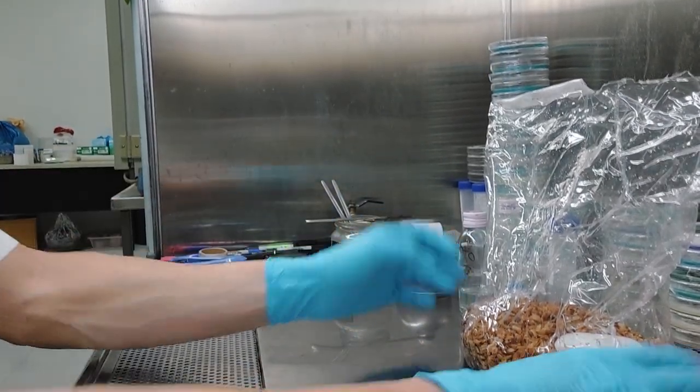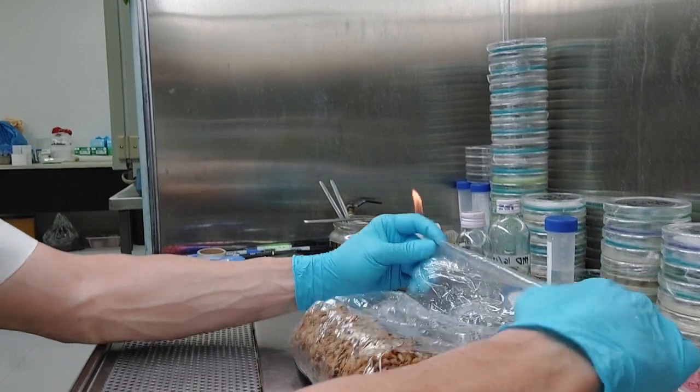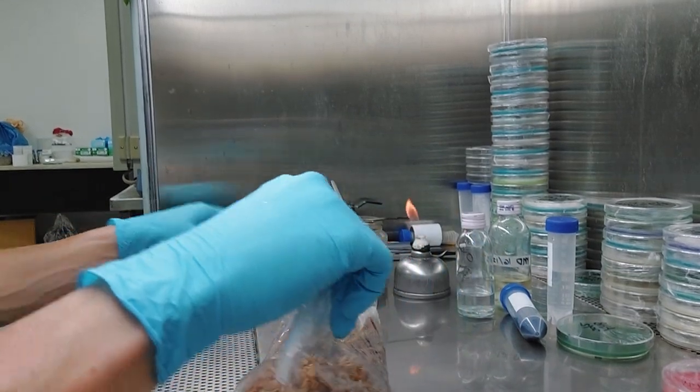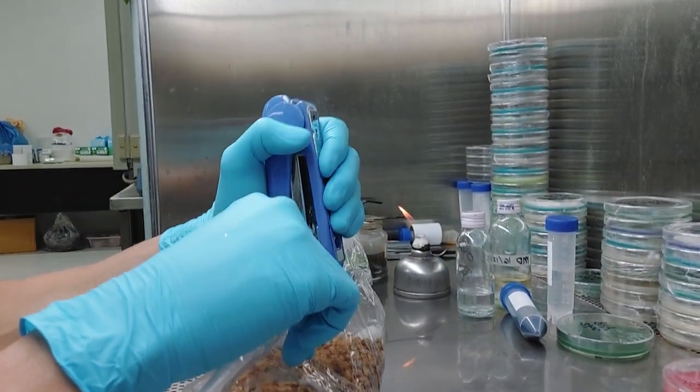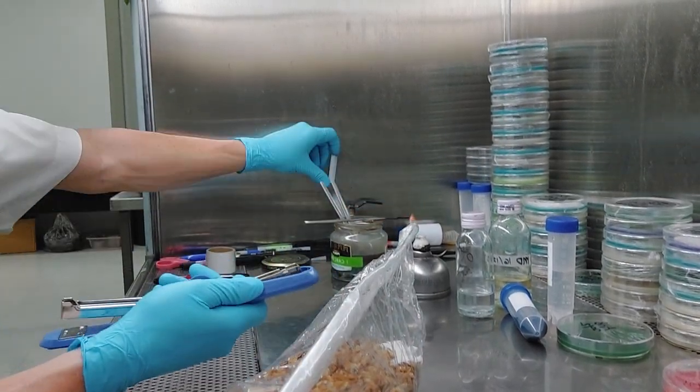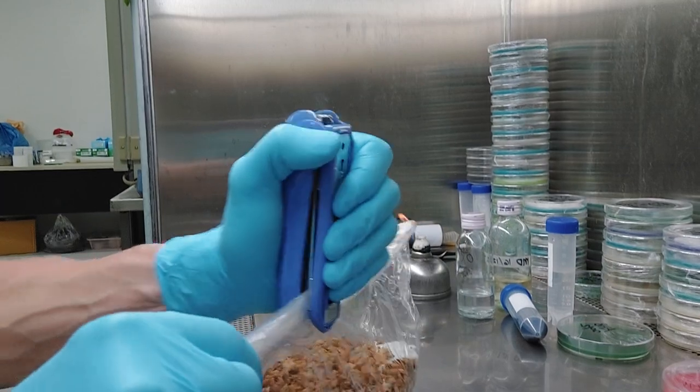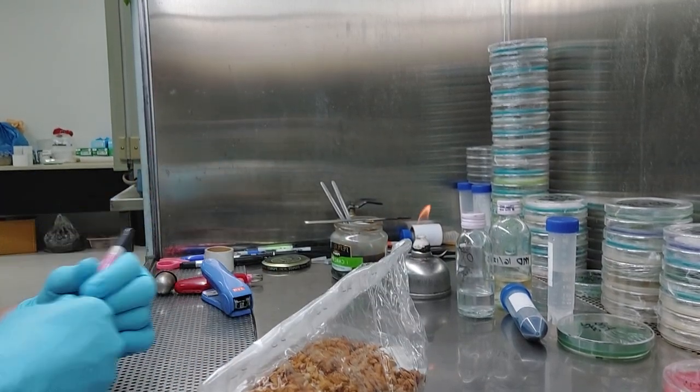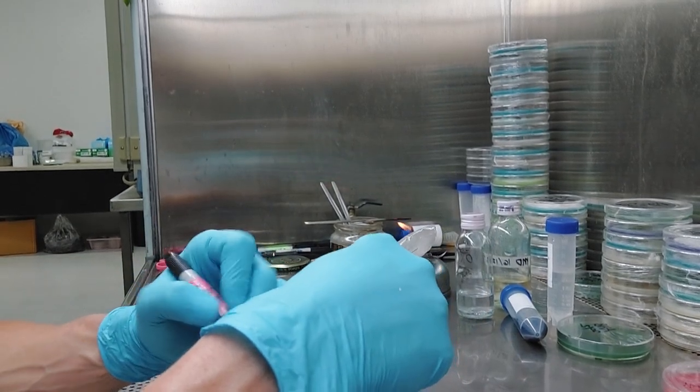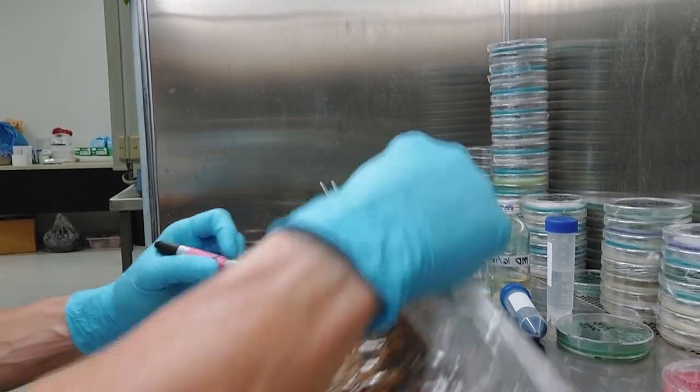I'm going to leave my scalpel sit there for a second. I'm going to close up my bag of spawn and you're going to have to develop a little technique to do this. If you choose cute bags, get some of the air out so I can roll this down on itself. And again, whatever you want to do, man, I try to get a little bit of the air out, staple it through the crease, like where it's, ah, just ran out of staples again. All right, I'm reloaded. Who hasn't got me on that? Some of you guys got that reference. That's a Scarface reference. Ah, Carlitos Way reference. I'm going to label this Al Pacino Carlitos Way. And I'm going to label this today is, there you go. Bing bong.